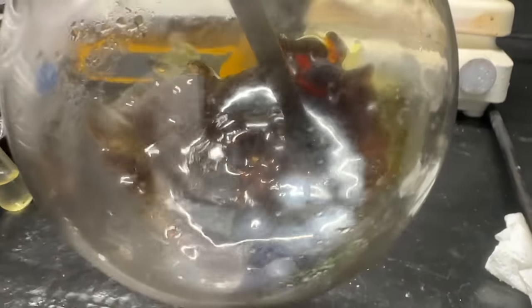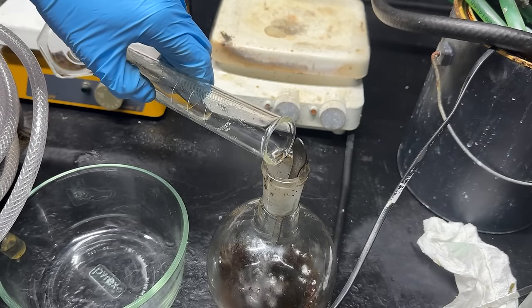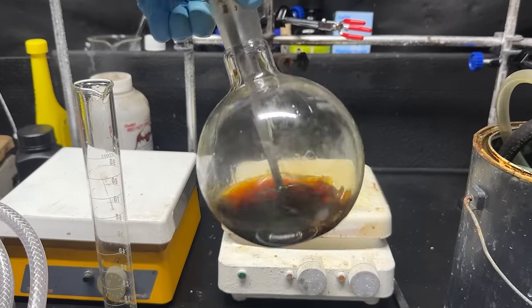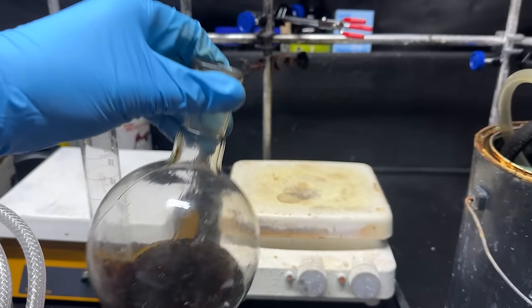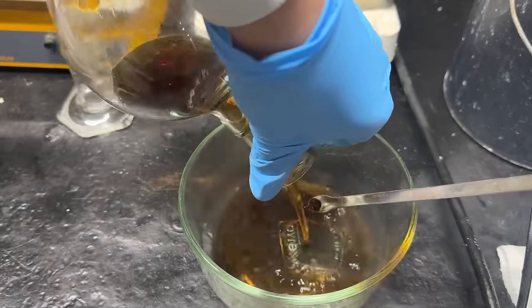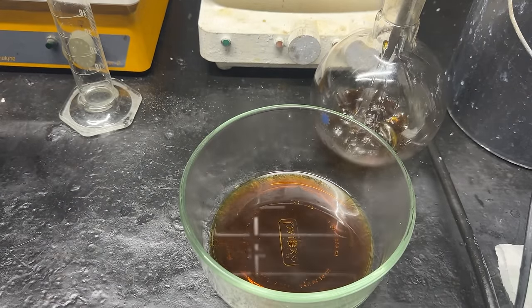After distilling down, we've got crystals but on top there's a tar-type layer, and below that it's crystalline — you might be able to hear it crackle. To purify this we're going to do a recrystallization. I'll add 50 milliliters of 95% ethanol into the flask, giving us a saturated solution of histamine dihydrochloride in ethanol. For the recrystallization I'll pour our hot ethanol solution into a recrystallizing dish. As it cools, the histamine should no longer be soluble and crash out. I've put it in the freezer to finish the recrystallization.